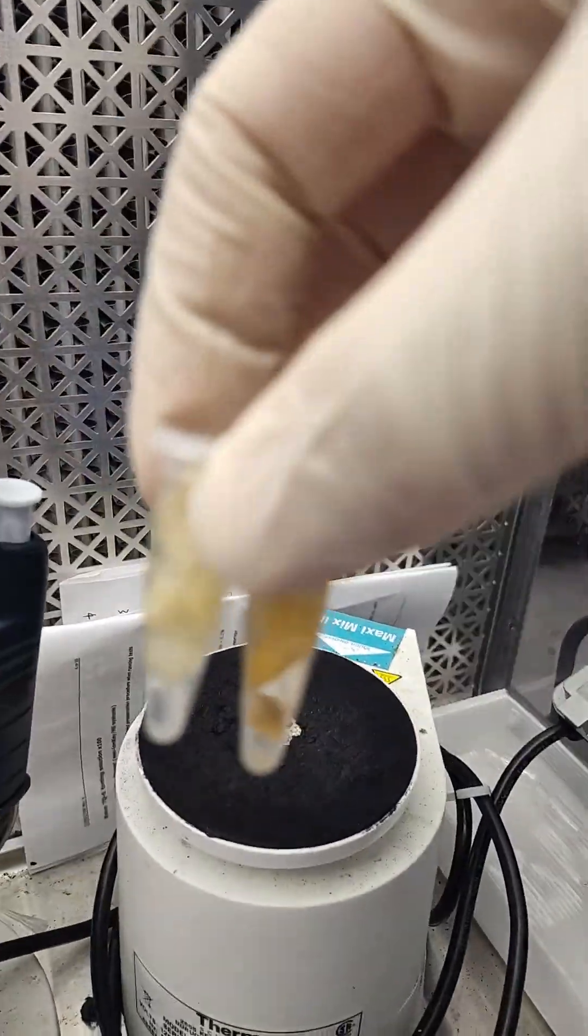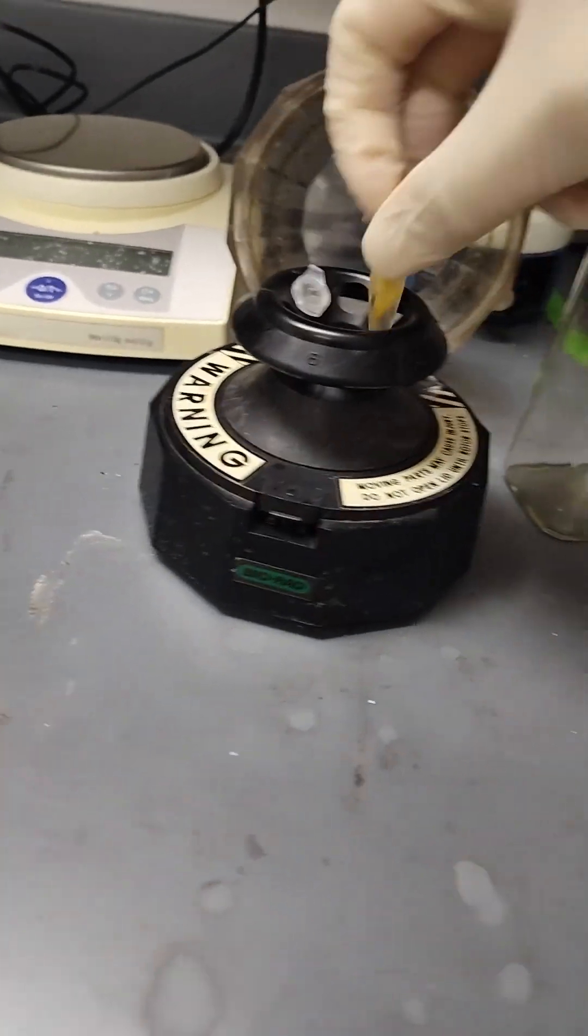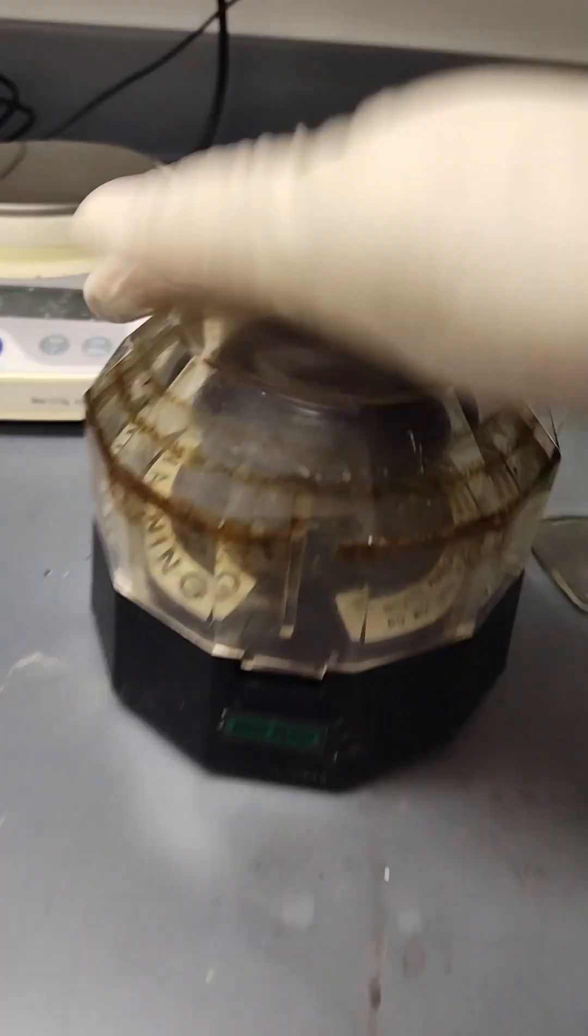Make sure they're all packed down in there. Then I'm going to even spin it down really quick just to make sure all of the french fry is below the liquid level.